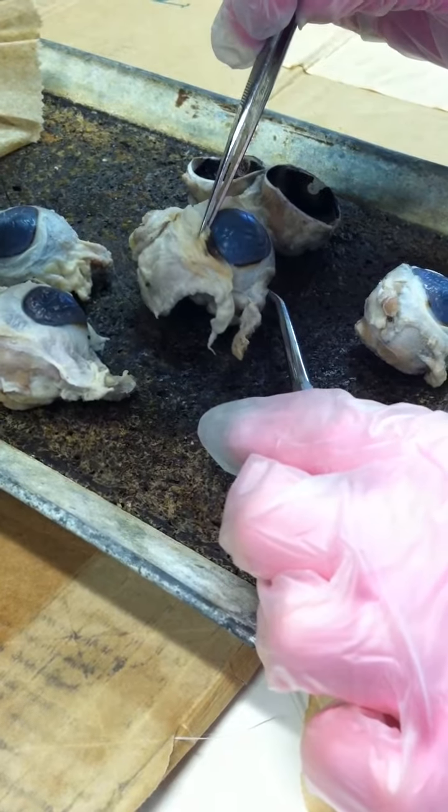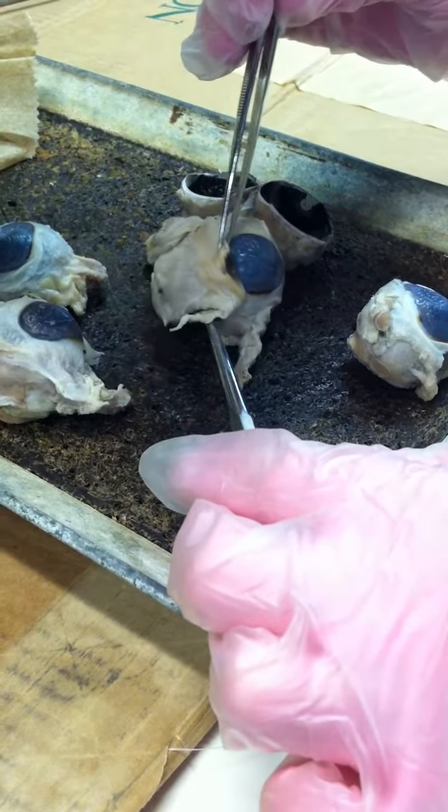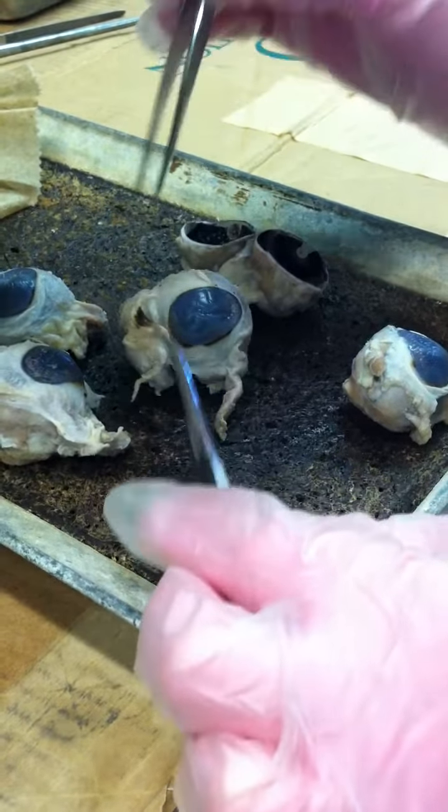And then the nictitating membrane is this kind of hard black thing. It covers up half the eye. It's a membrane that covers the inner portion. Yeah, my eye didn't have that originally. Yeah, a lot of them don't have them.